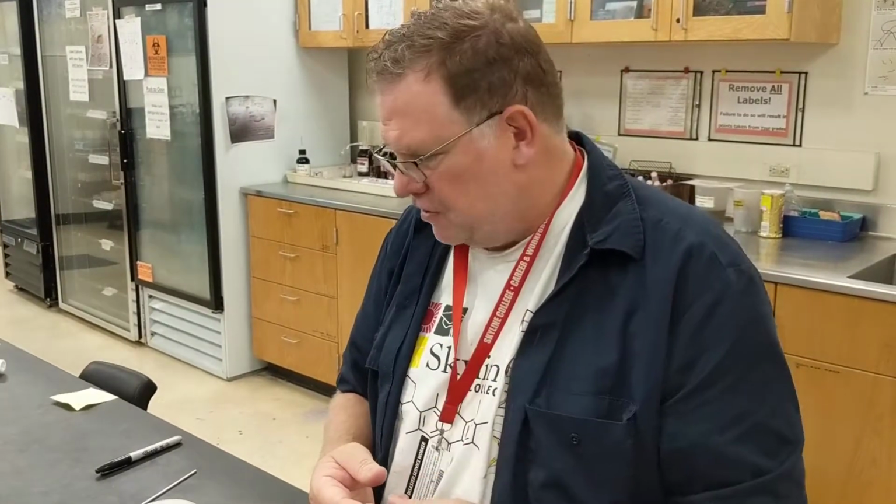Today we're going to be looking at laboratory number 11, looking at the exoenzymes and the procedures that you're going to need to use for that. And then laboratory number 12, which is looking at carbohydrate metabolism, how we look at that and how we do our inoculations. Again, in all these things, I'm just showing you and reminding you a little bit about the techniques that you should look at.